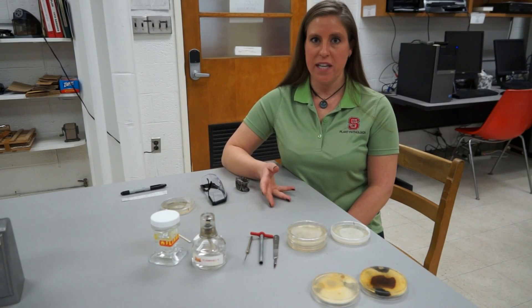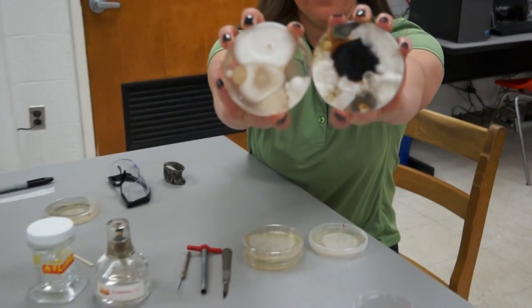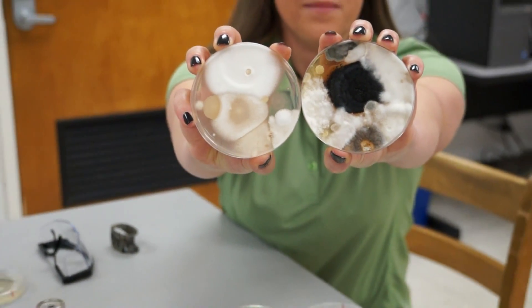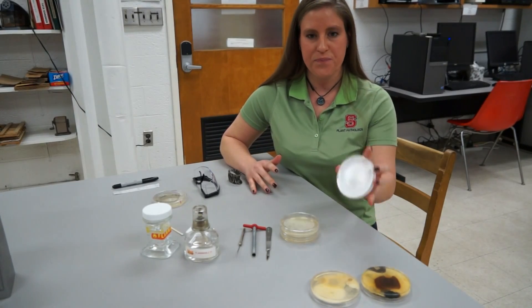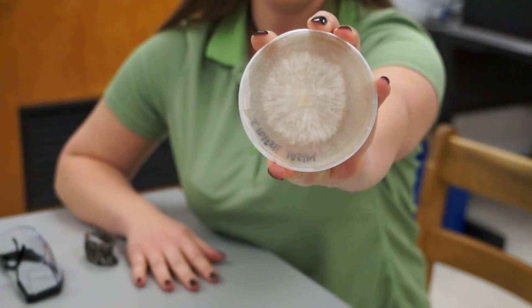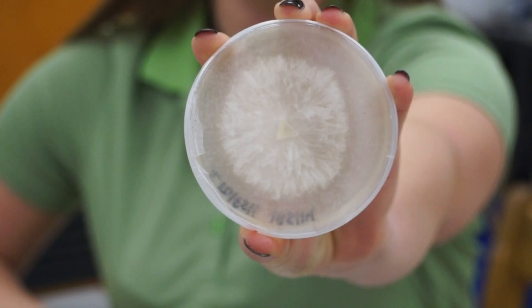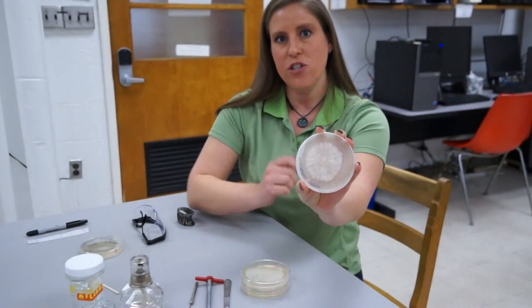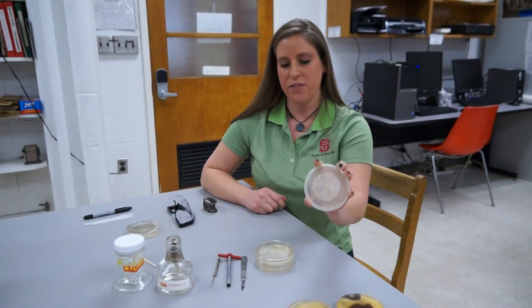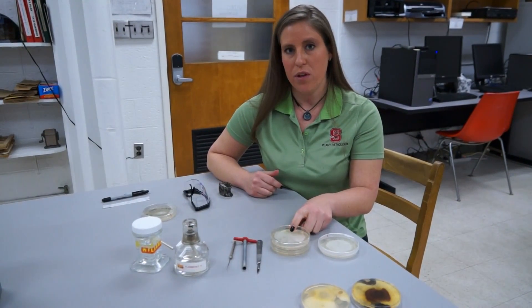If you don't keep pure cultures, you'll end up with contamination and plates that look like this. For materials, first you need your fungal culture. Today we're working with Sclerotium rolfsii — you can see that it's growing radially. There are a lot of mycelial strands, and when we cut this culture we're going to cut from the outside edge because that's where the culture is actively growing.